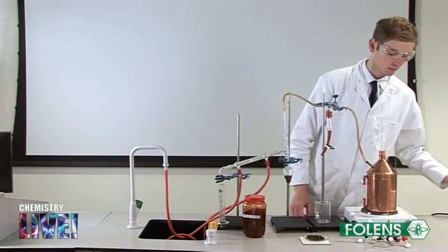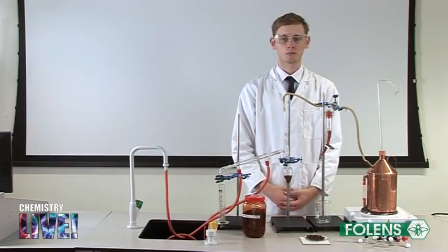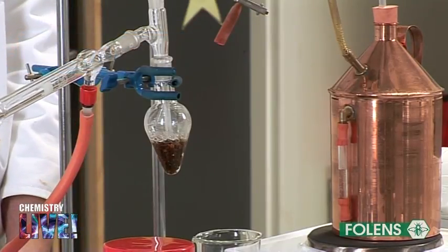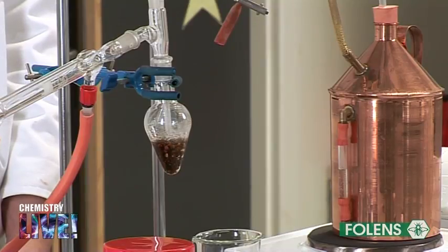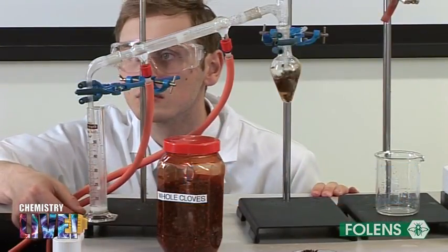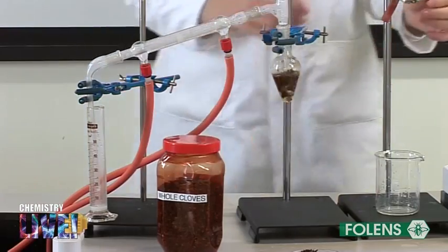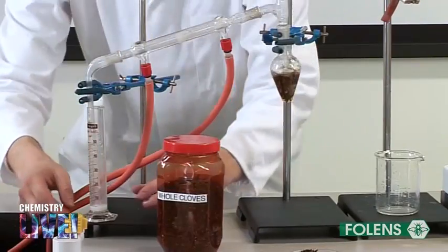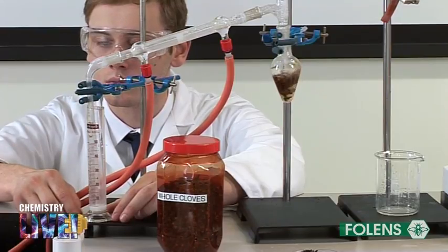Turn on the hotplate and pass steam through the flask until a sufficient amount of the clove oil emulsion is carried over. Note that the emulsion has a milky colour. From time to time we may also have to empty the steam trap of water. We notice that the white milky coloured liquid is being extracted from the cloves.